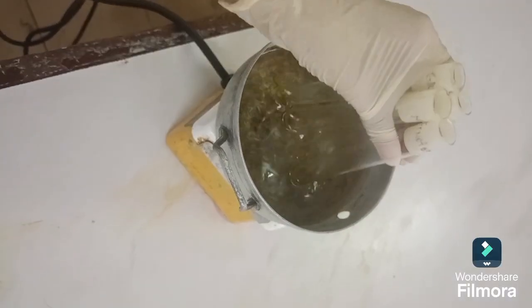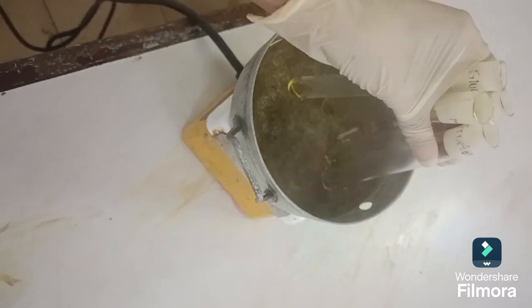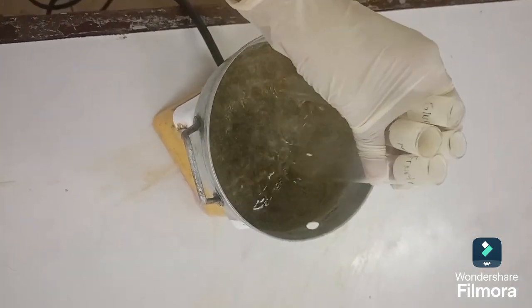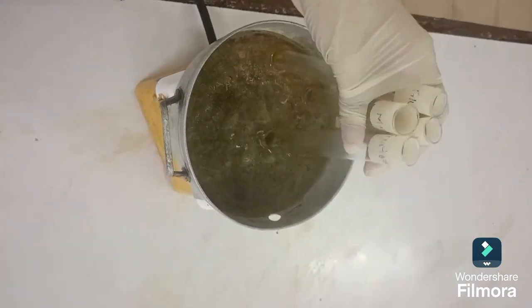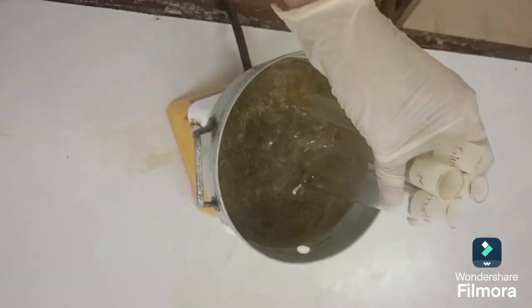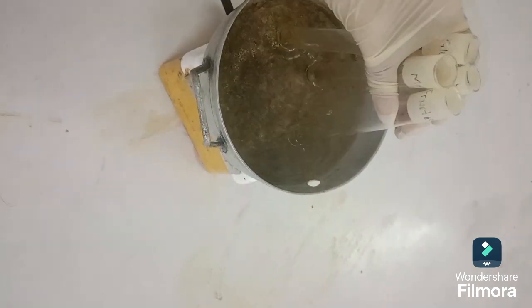Now, the crucial step. We'll place all 4 test tubes in a boiling water bath for exactly 1 minute. This controlled heating is essential for the reaction to occur properly. After 1 minute, we'll observe any color changes. Remember, we're looking for the formation of a colored product, which indicates a positive result. We'll note the time it takes for any color to appear. We'll continue to heat the tubes and observe for any further changes.